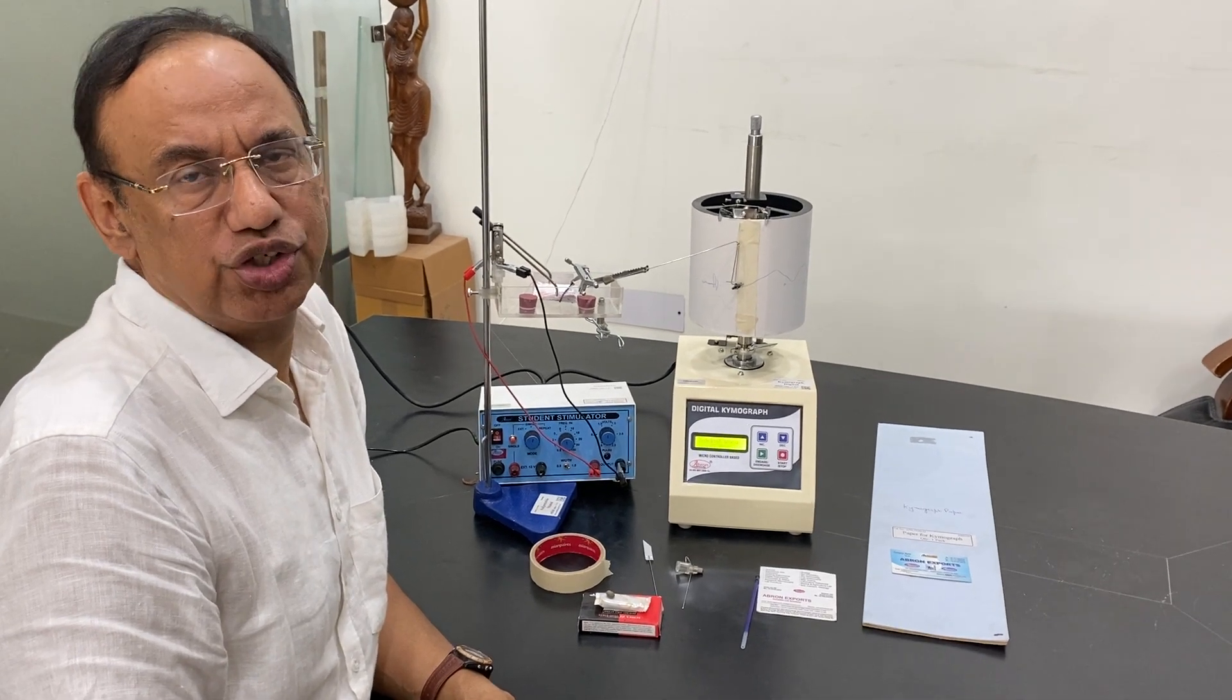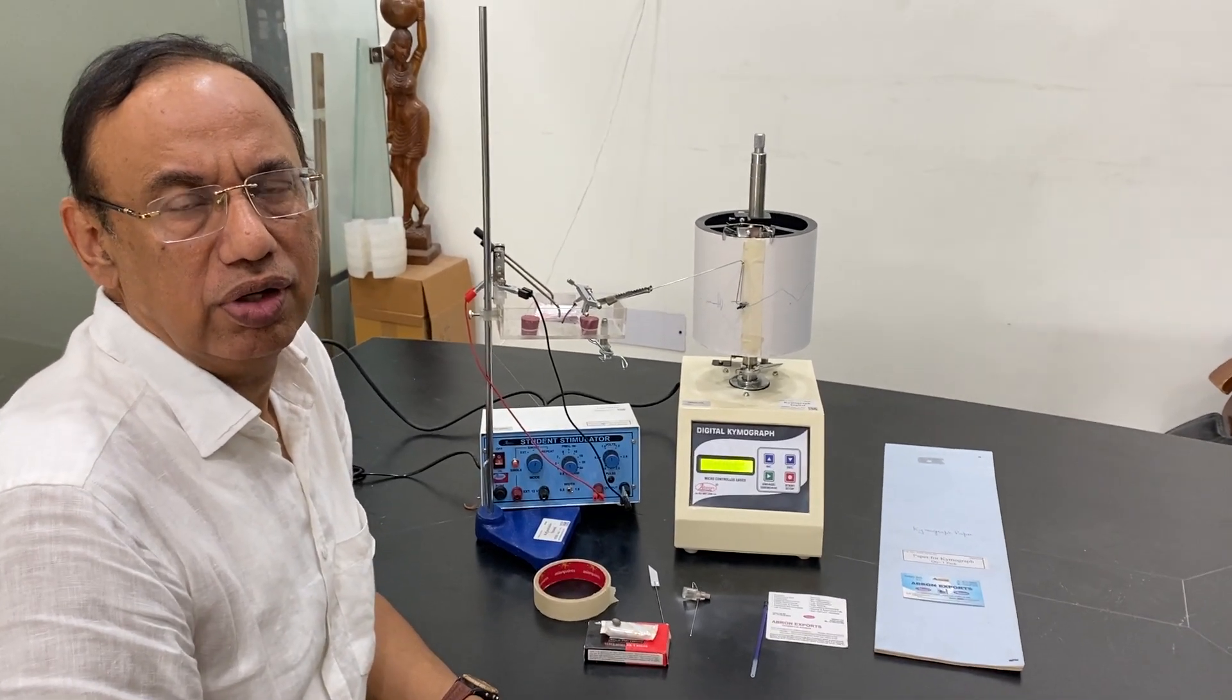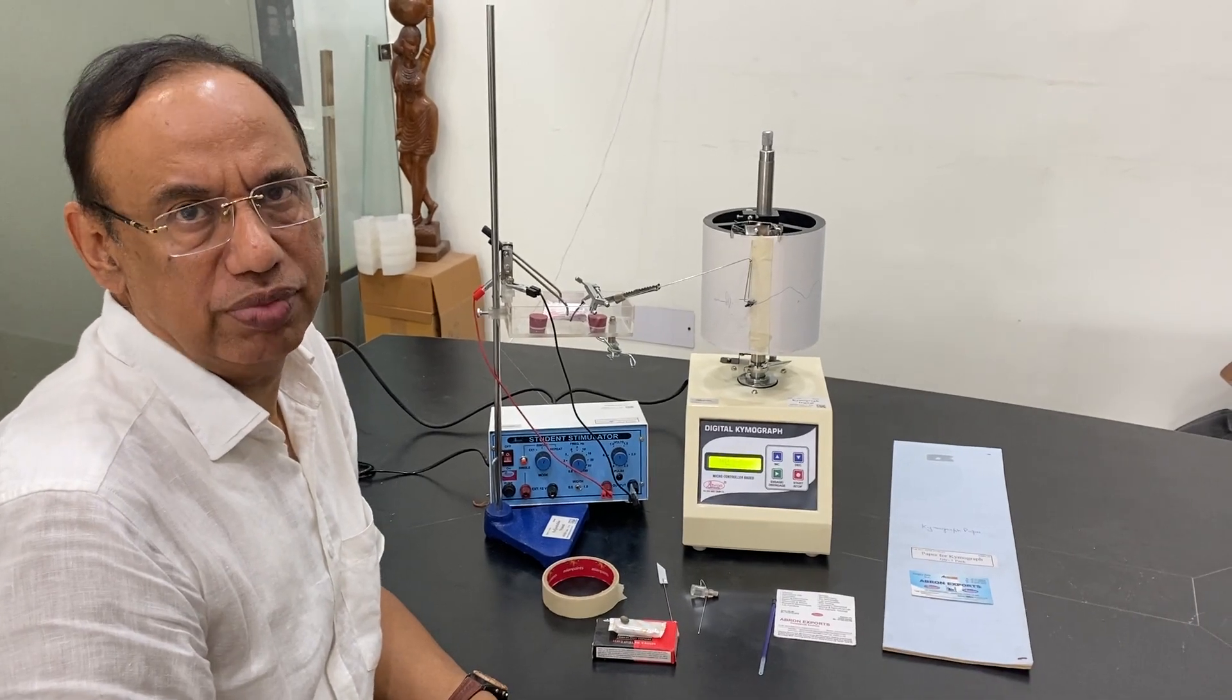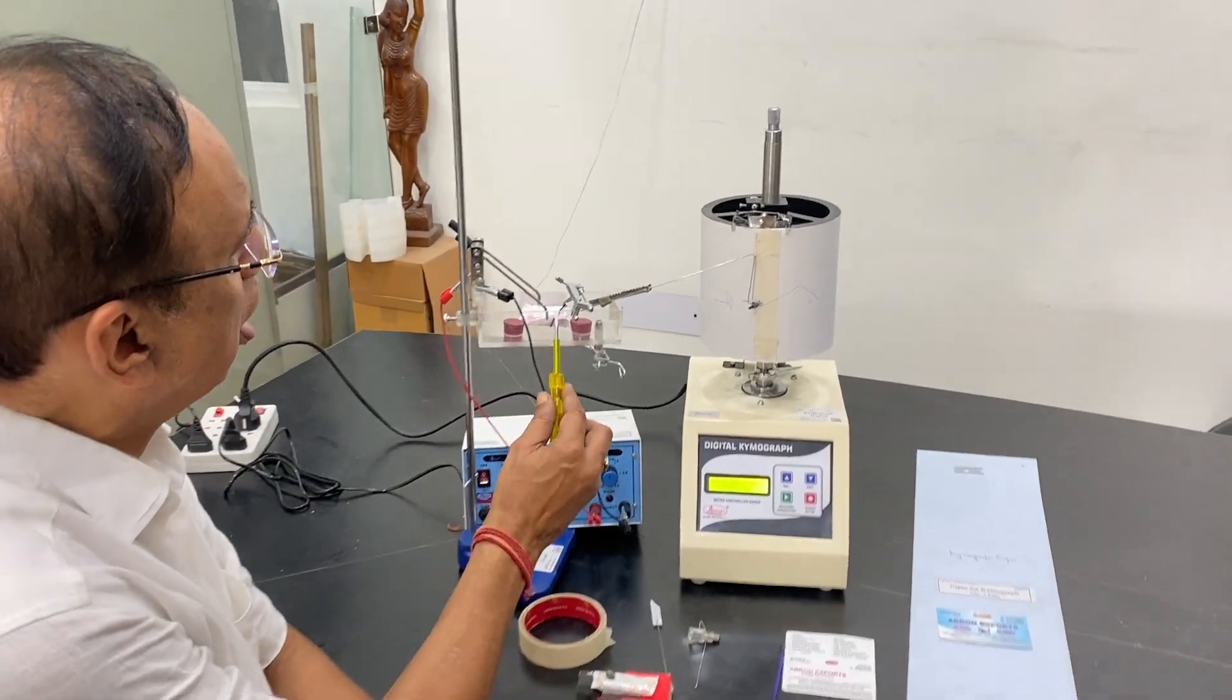Welcome to the demonstration working of the frog heart chamber. Let's see, this is the heart chamber.